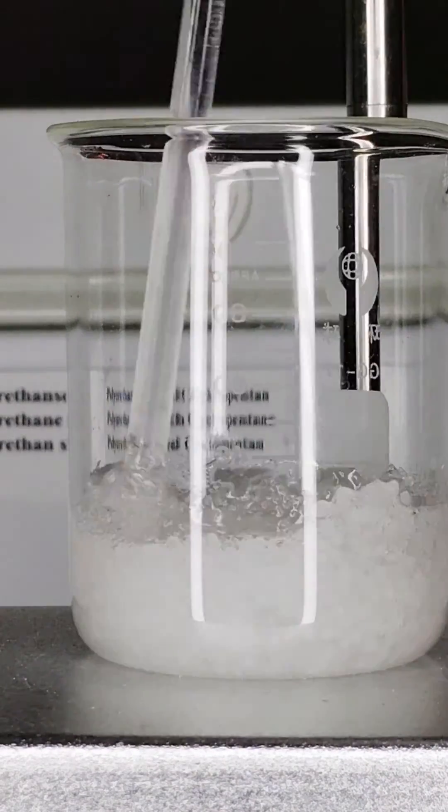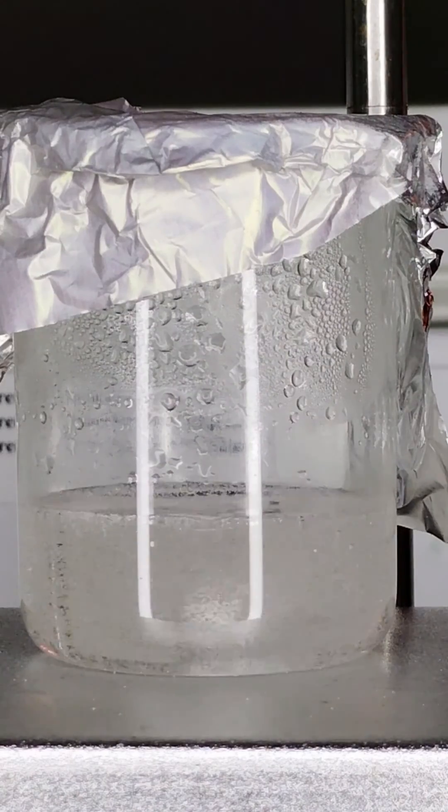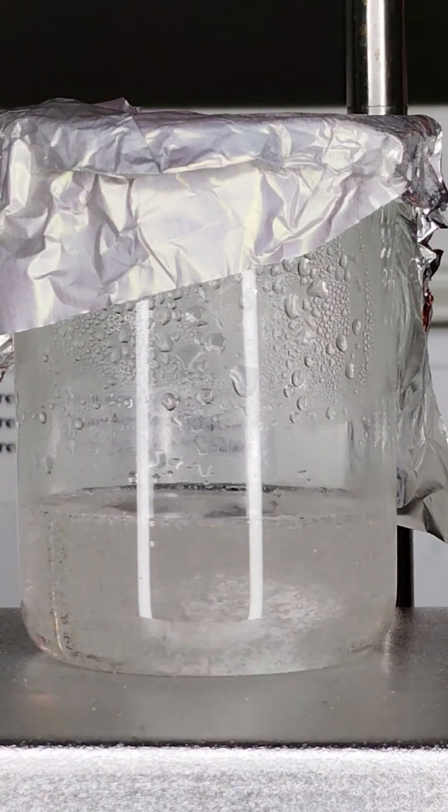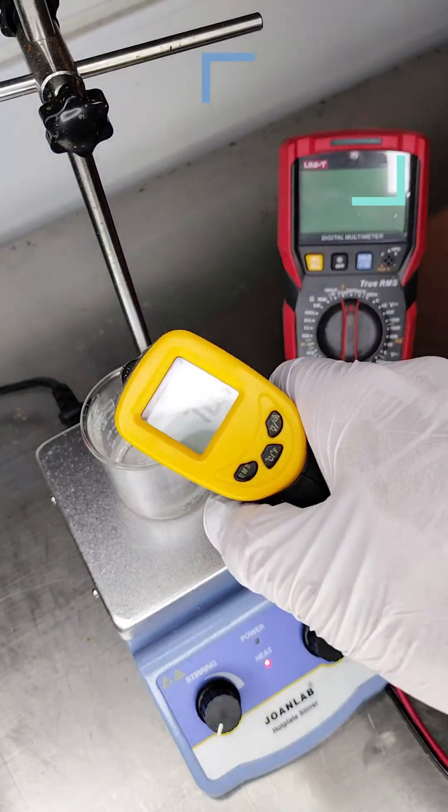Next, add the selected ionic liquid base, urea, to the container. The ionic liquid base should be compatible and capable of dissolving the aluminum compound. You can choose your own combination if needed.